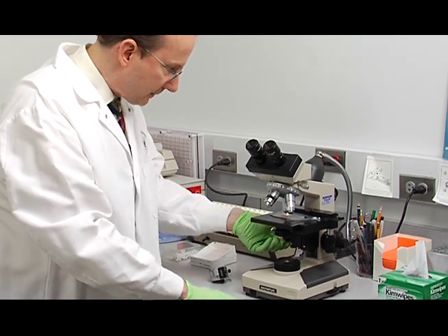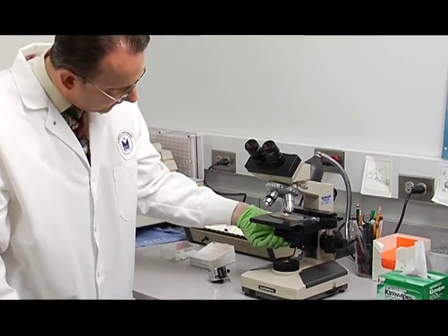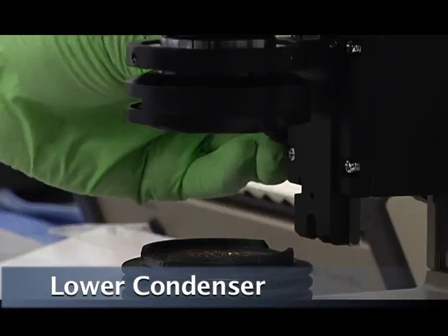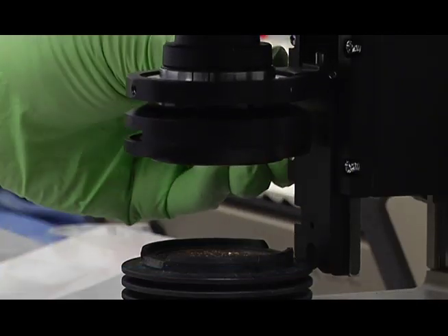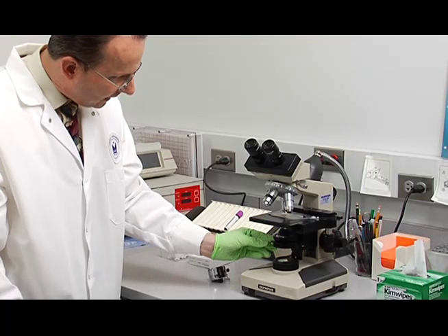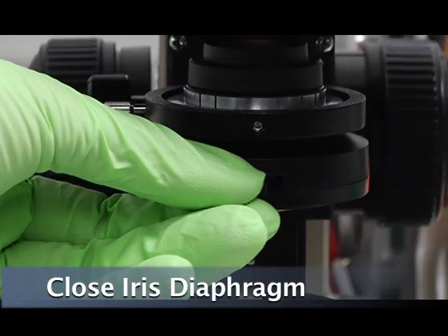Now lower your condenser and then close the iris diaphragm.